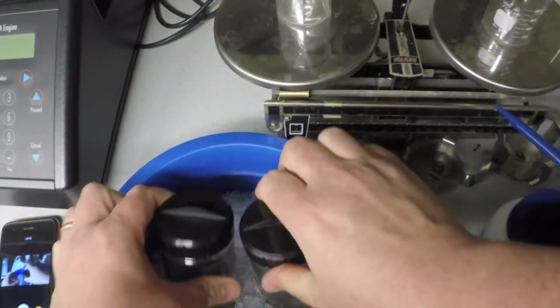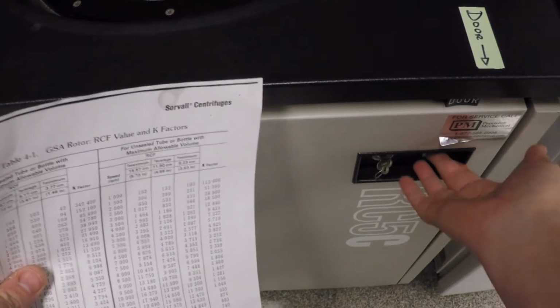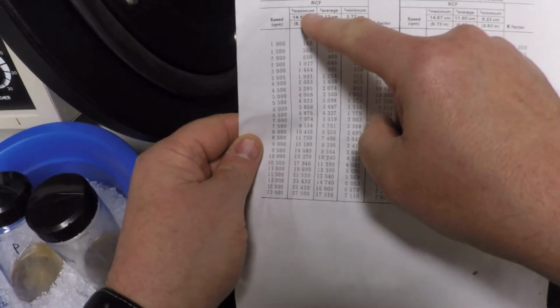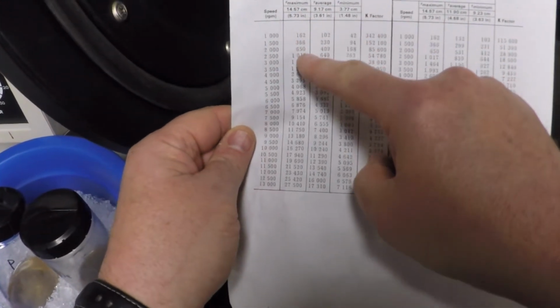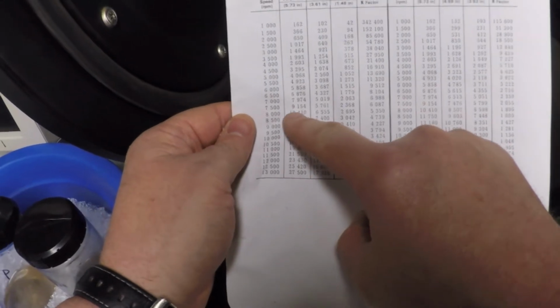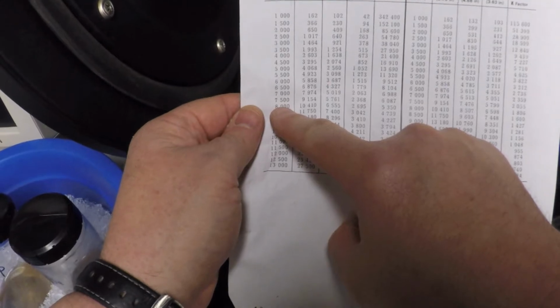Okay, so now let's go find out from our table what's 10,000 times G. Turn this back on again. I dutifully turned it off. So we look at our thing and we want maximum relative centrifugal force. Come down here till it says close to 10,000. There's 10 grand right there. So it says about 8,000 RPM for this rotor.